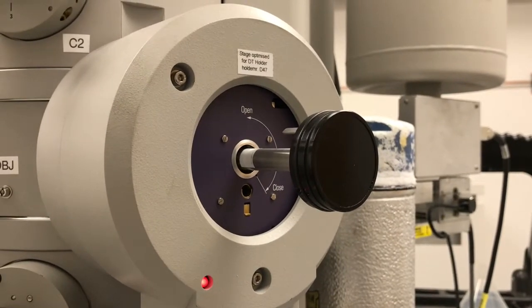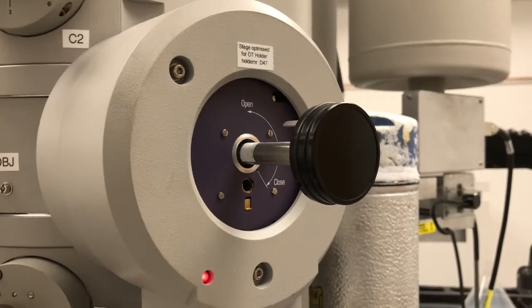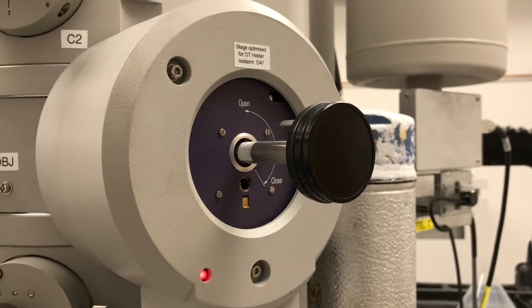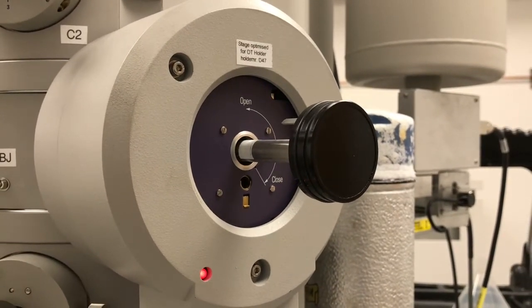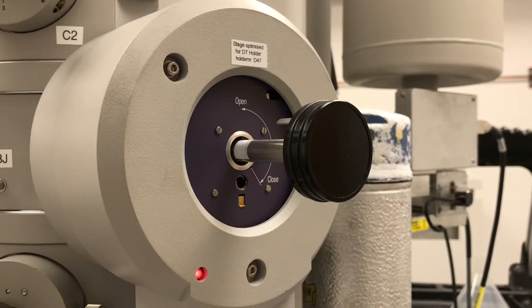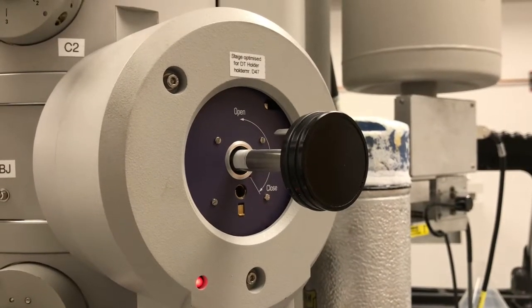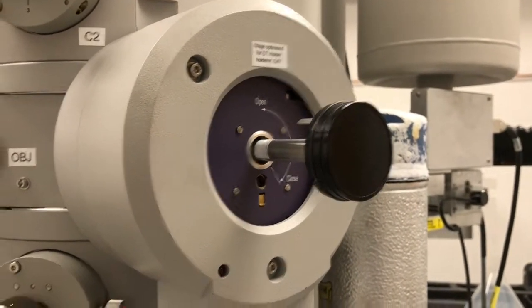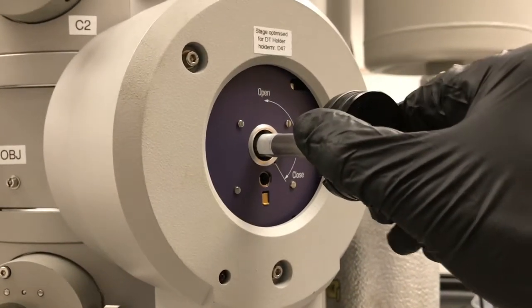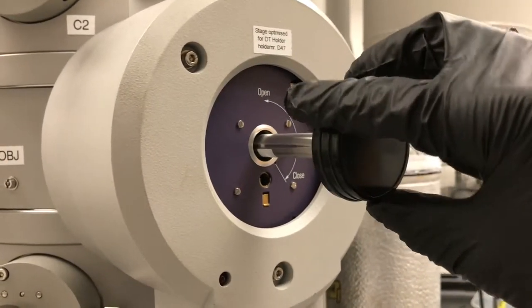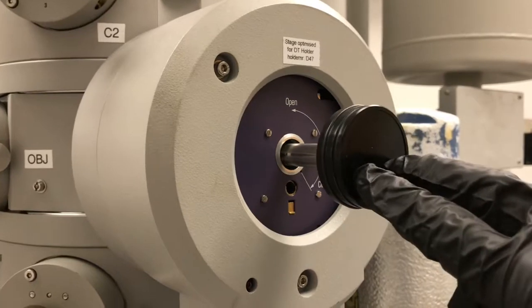Like 10 more seconds. All right, light goes off.